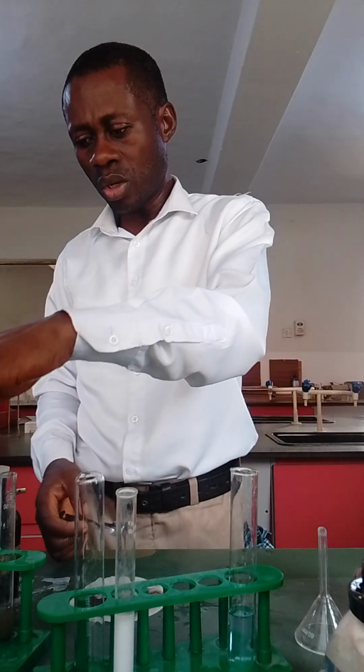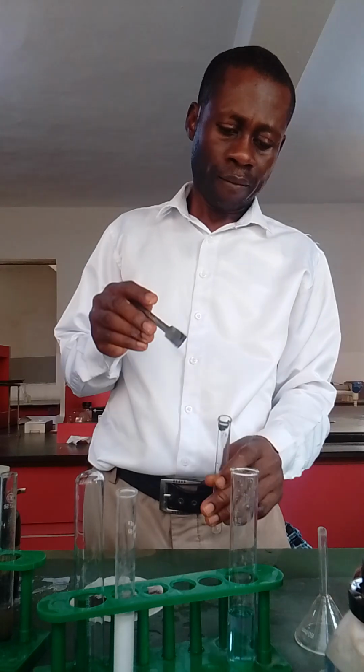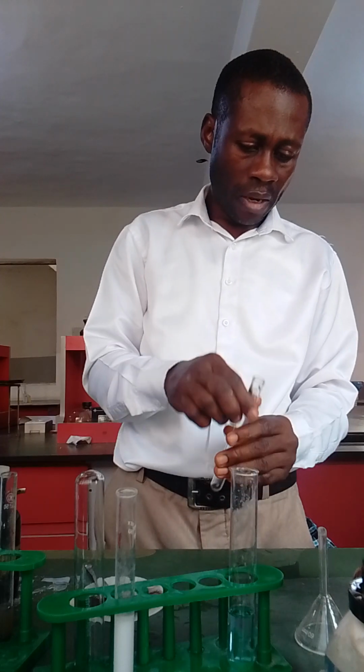You can also be asked, depending on how the question goes, to take the residue and add dilute ammonia. So if you're asked to add dilute ammonia, you have your ammonia, to confirm the presence of that.